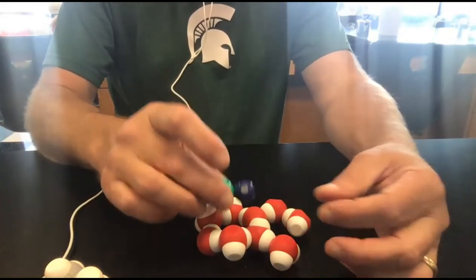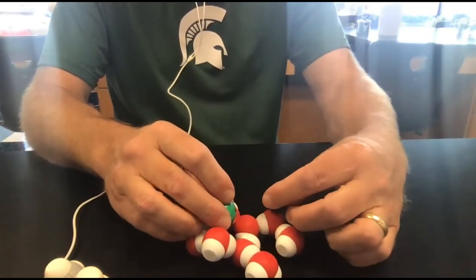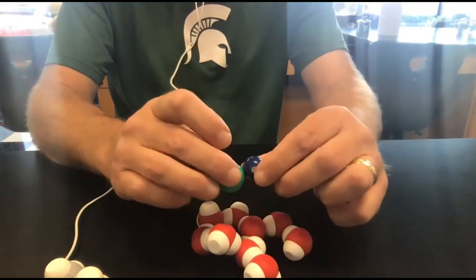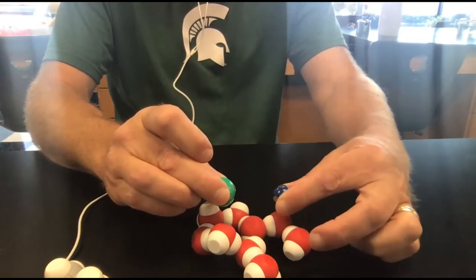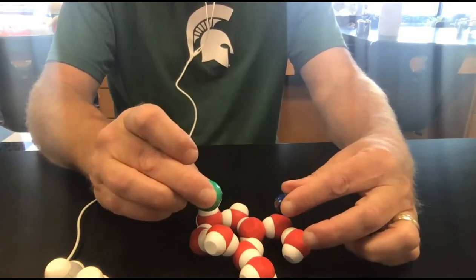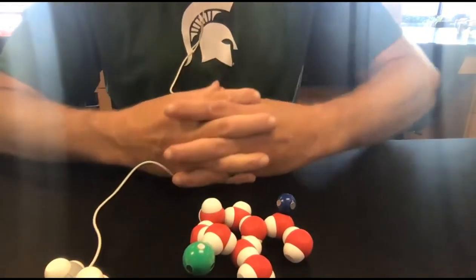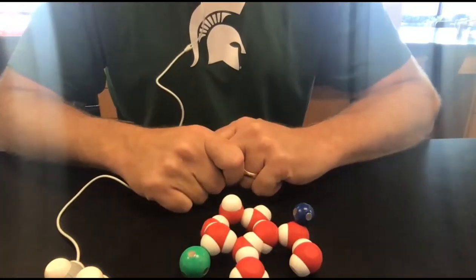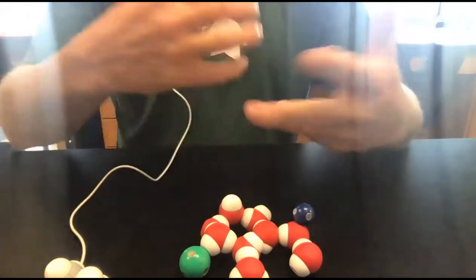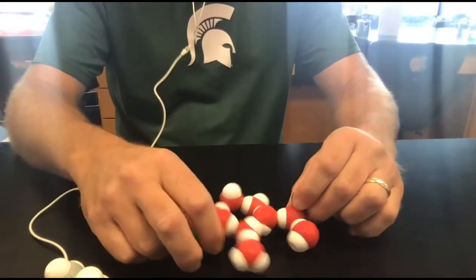So when I put this ion into water, let me throw a little bit more water in here, some of the positive sodium is going to be attracted to the negative oxygen. And that's going to cause this molecule to split. This positive sodium gets attracted to that negative oxygen, and this negative chlorine gets attracted to that positive hydrogen. And voila, the sodium chloride has dissolved, split. It's mixed in with the water.